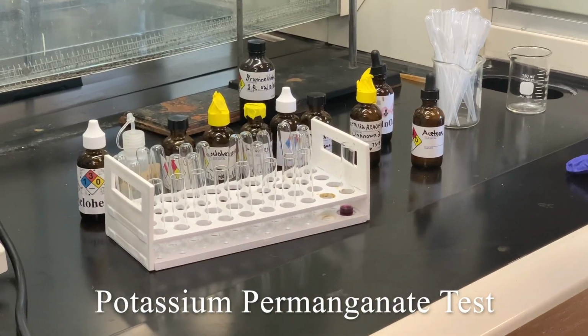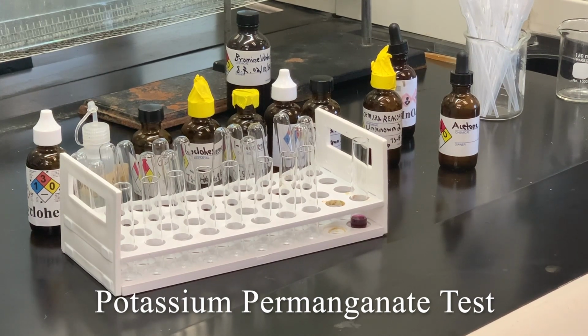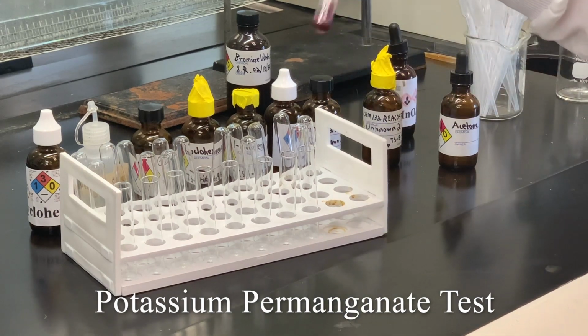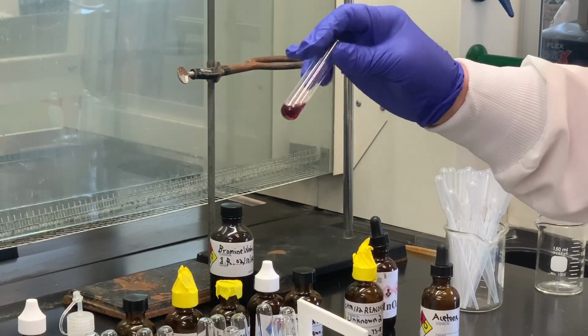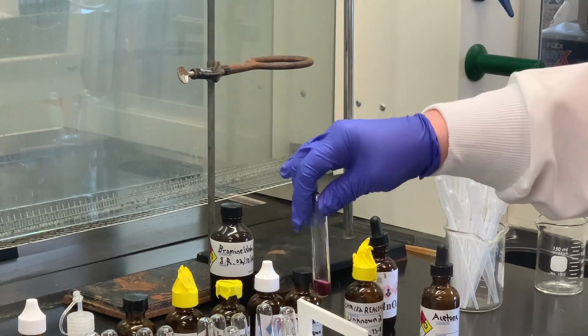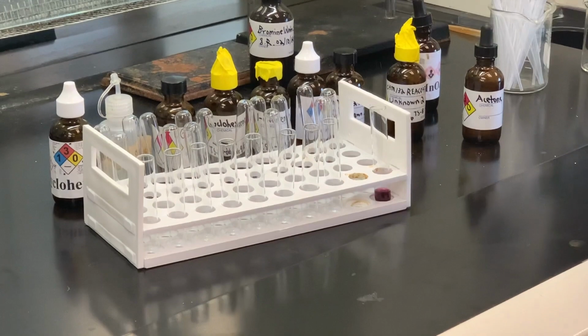So the second part of the experiment is to test the same substances that we used for the bromine test, but now we're going to treat that with potassium permanganate. What I have here is a test tube that is a control. This contains acetone, the solvent, and then a drop of the potassium permanganate, which has that purple color. So we're going to keep comparing it to that during the experiment.